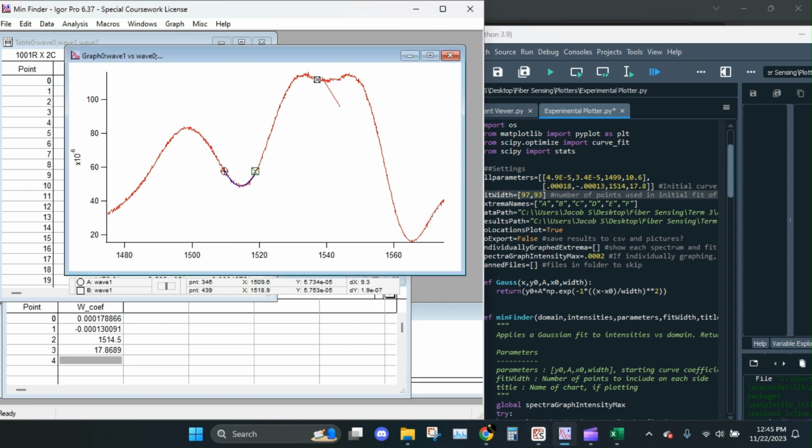Okay, let's see if we can apply a fit to this. I guess is not hopeful. Let's see.